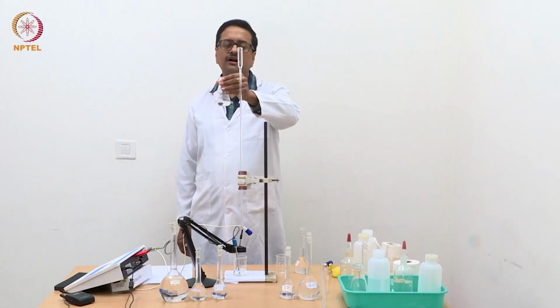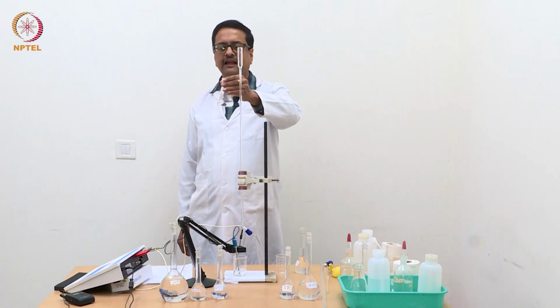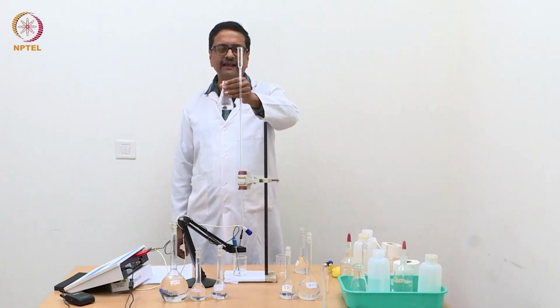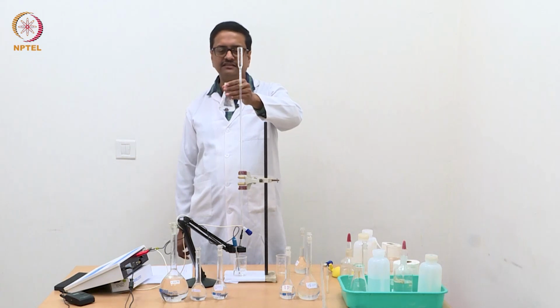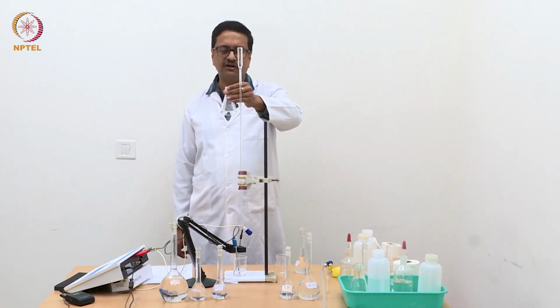We want to use the conductometric method to estimate the concentration of the individual components: HCl, ammonium chloride and KCl. HCl is, as you know, a strong acid.